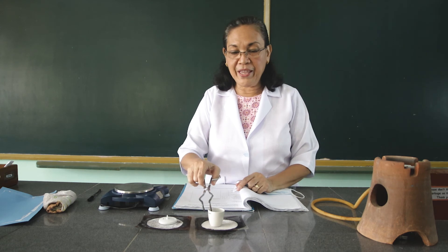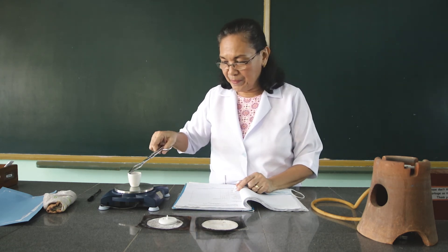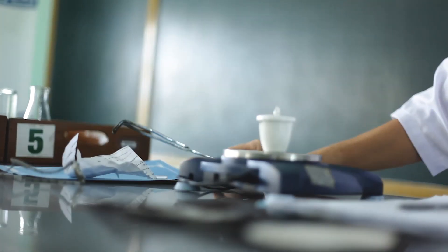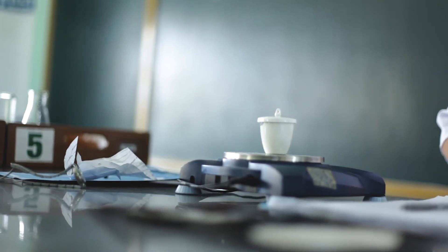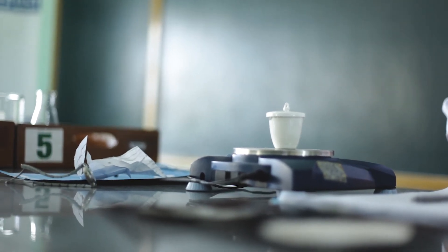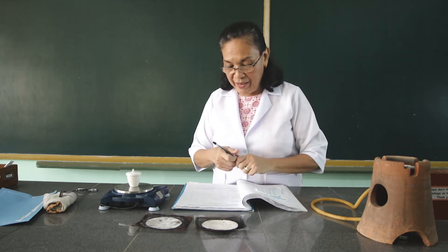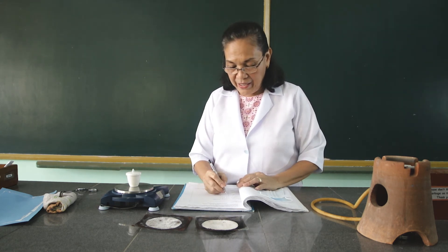After cooling this crucible, we are going to weigh it again with the cover. The weight is 34.82 grams — kindly write it down. The second heating result is 34.82 grams.